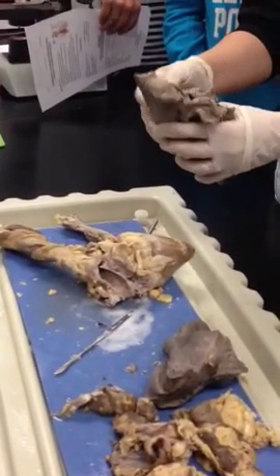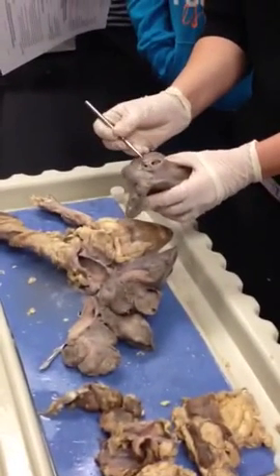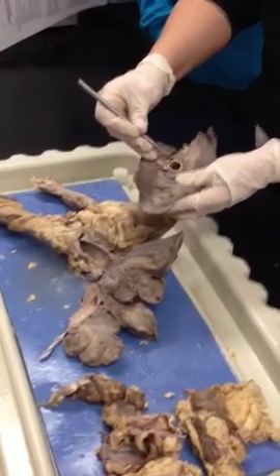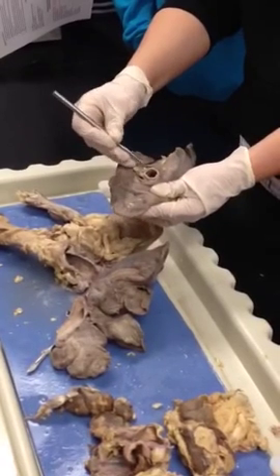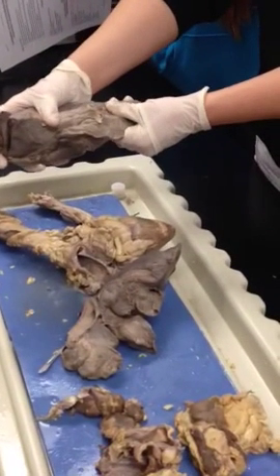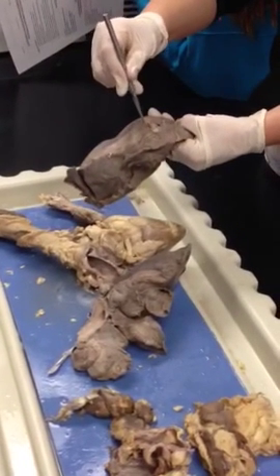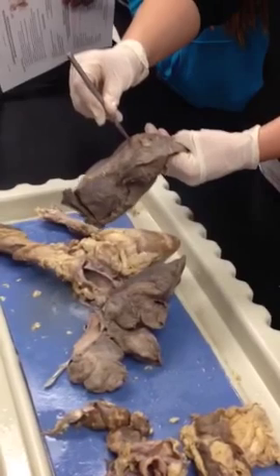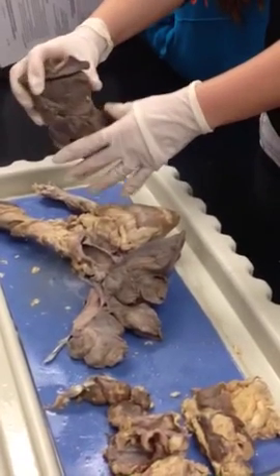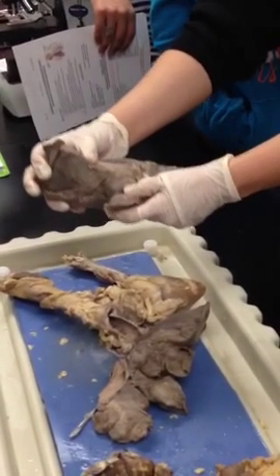Can you go over the arteries in the other one? Yeah, the arteries. So you have your primary bronchi. Your pulmonary artery is up here, closest to the smaller lobe, the superior lobe, and then your pulmonary vein is more inferior to the artery. This is why it's really good for you to look at these, because I could ask you about this vessel up here. You better not say pulmonary artery because you're going to be incorrect. If I'm looking at this, this is a much smaller lobe than this one, so this vessel is closer to the large lobe. It's the pulmonary vein.